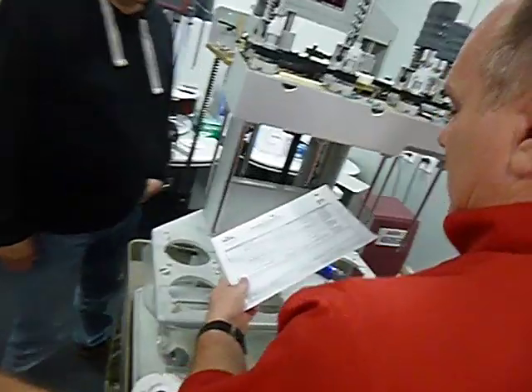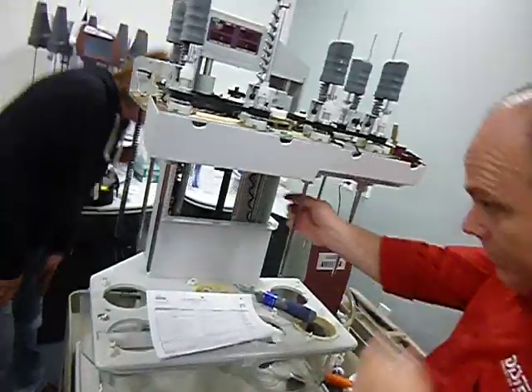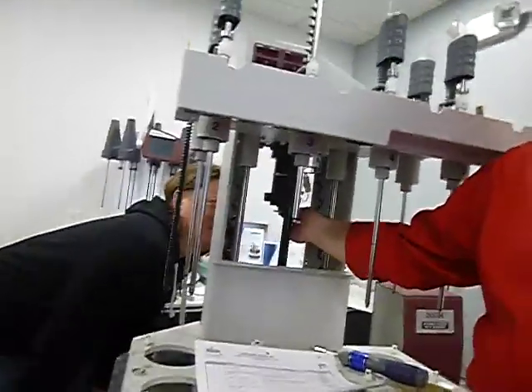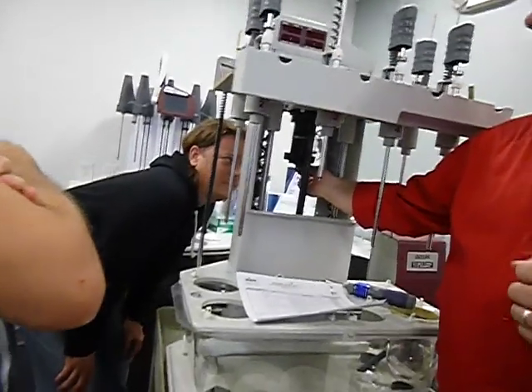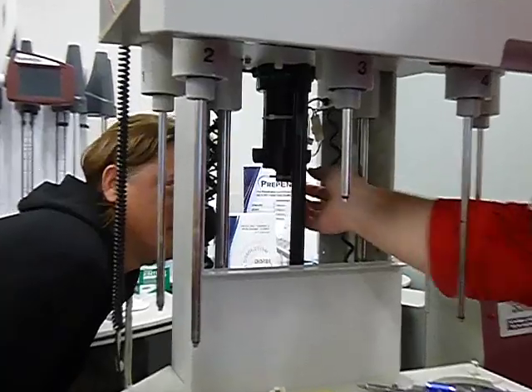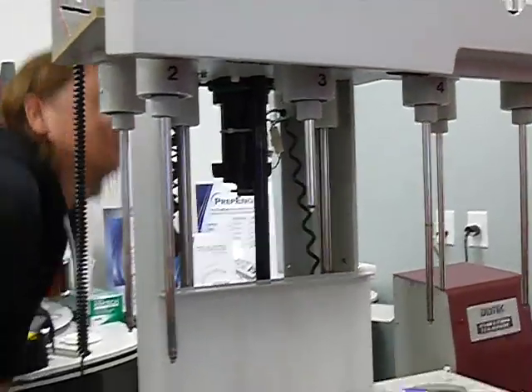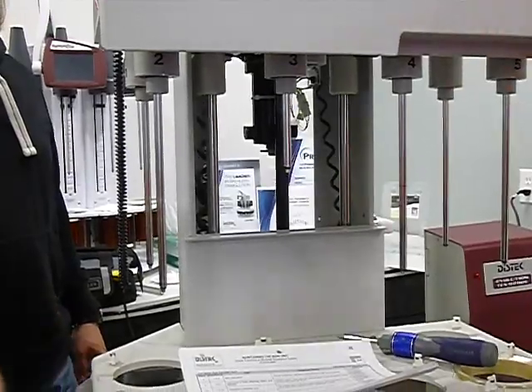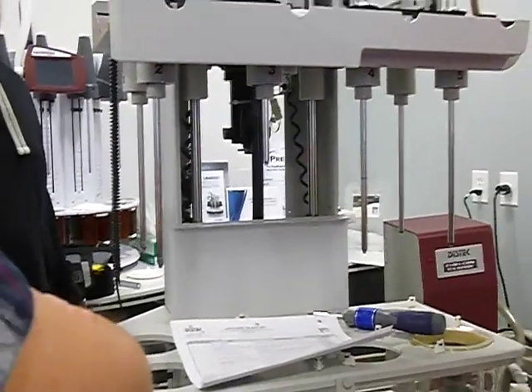Inspection of the magnetic pickup. As I talked about before on the motor, this is your magnetic pickup right here. There's an actual gap that it can be adjusted to. I'm not sure what it is. It probably has it in the documentation. If it's working, my motto is if it ain't broke, don't fix it. If the RPM all works, there's no reason to touch it.